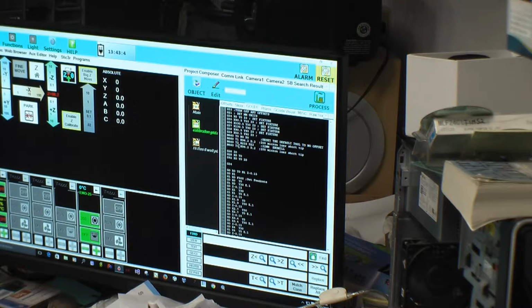So now instead of T1, T0 is the 0 offsets. 1, 2, 3, 4. 1, 2, 3, 4. So that's going to be T4. Should be. And this may be very confusing and we may end up changing that back. But here it is, H4. There. Now it should use offset from head 4.